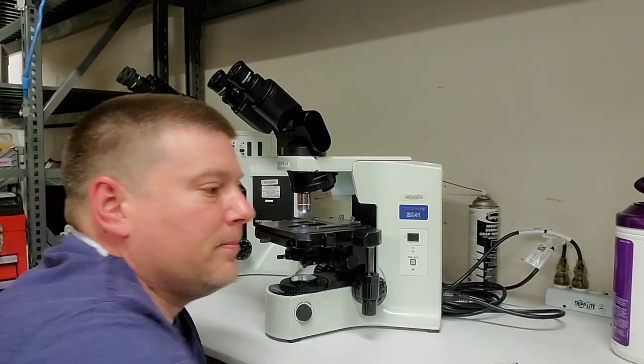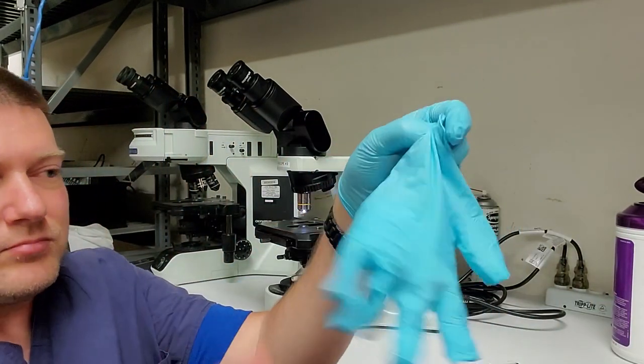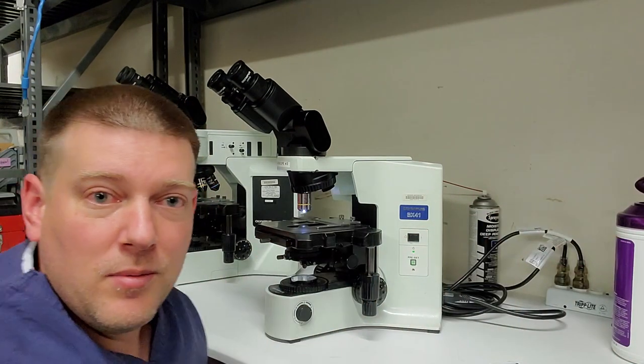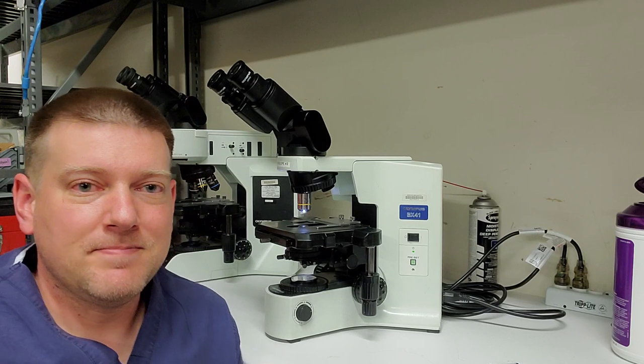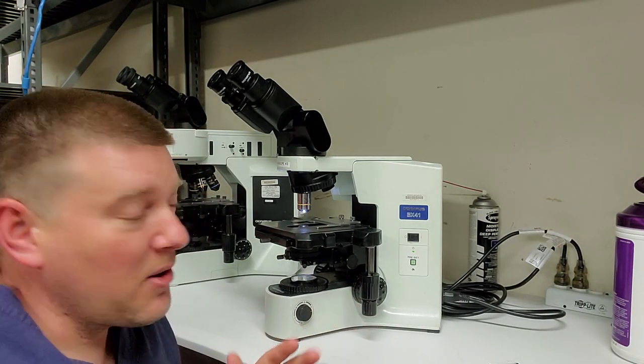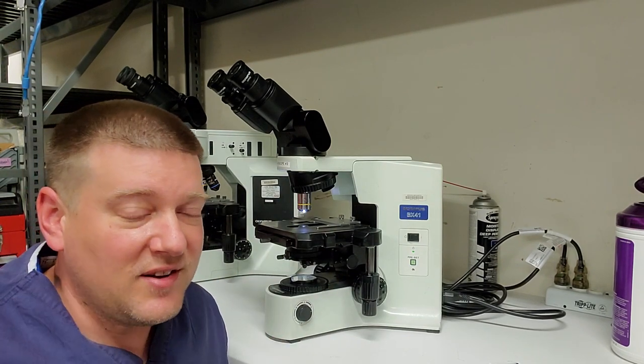Not too bad, right? All right, gather up all my consumables, put them in a glove, and now all my contamination is contained. All right, guys, I hope you like this video. I know it's kind of a long one, but this is an in-depth procedure. Now, I know a lot of microscopes, you think that they're nice and simple.